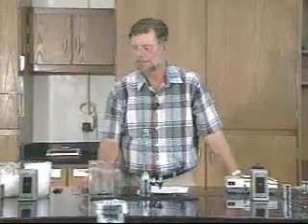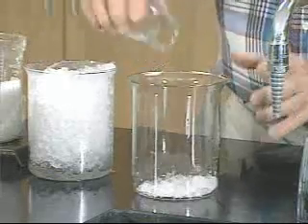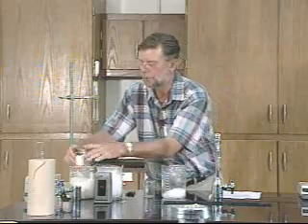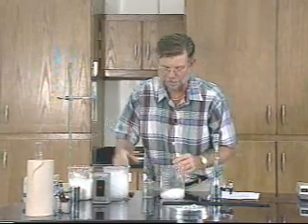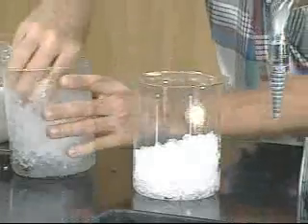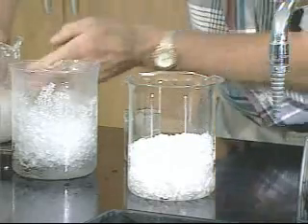Now let's go to how we're actually going to conduct the experiment. I have a large beaker and we're going to make a salt cooling bath. I'm going to pour in some ice, then add a layer of rock salt — you need more ice than rock salt, so don't flood it with salt — then another layer of ice, and then pour some more rock salt in. You need more ice than salt.